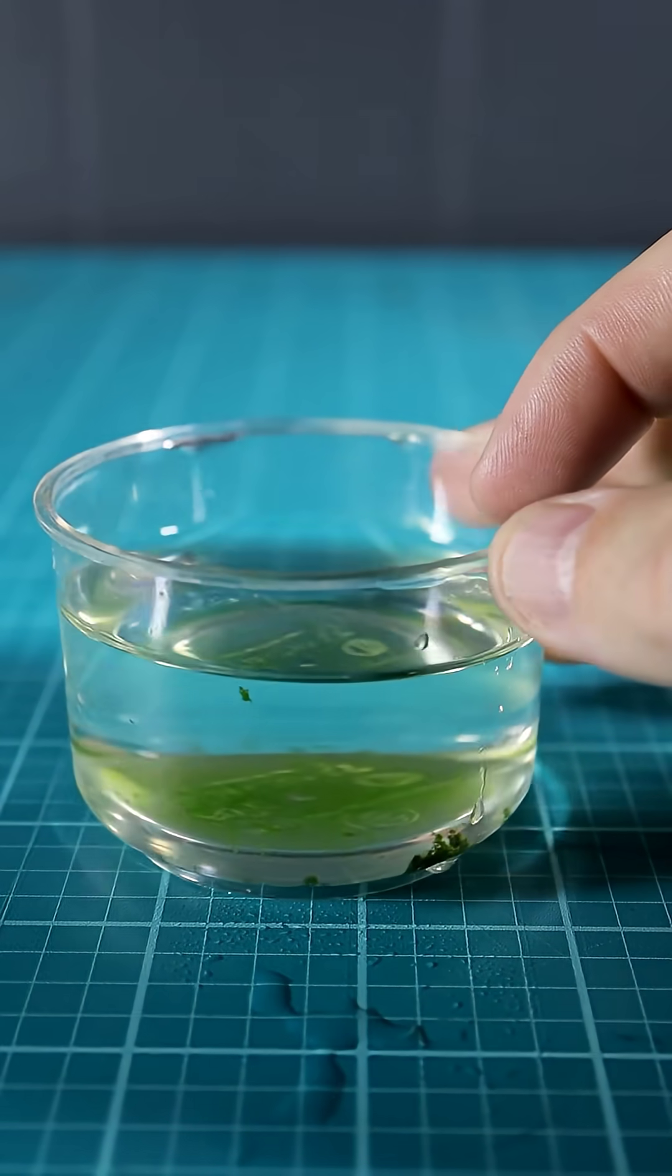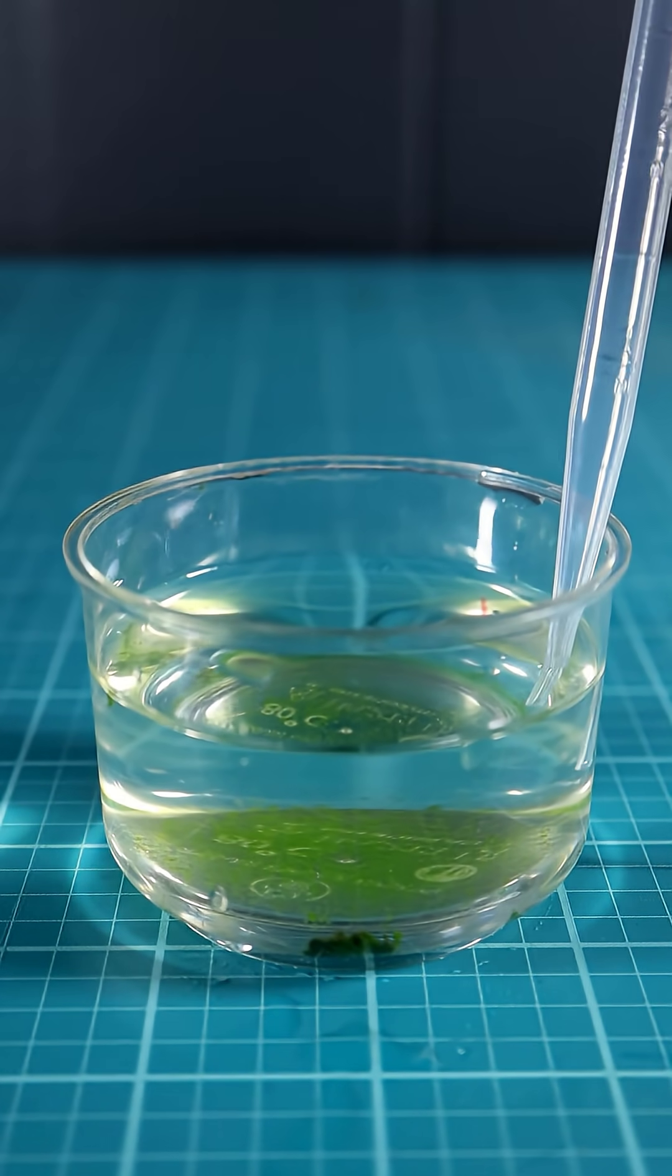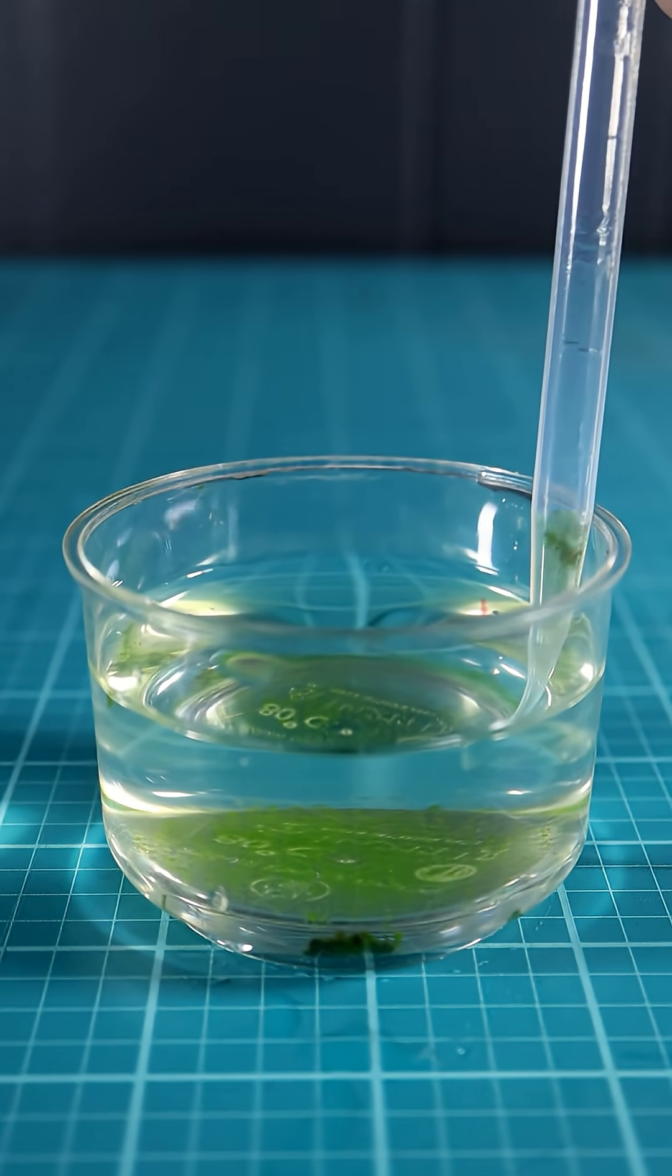In this plastic cup is where I hold my snail eggs. They've grown up and left that little cup. I want to test the water and see what little critters I can find.